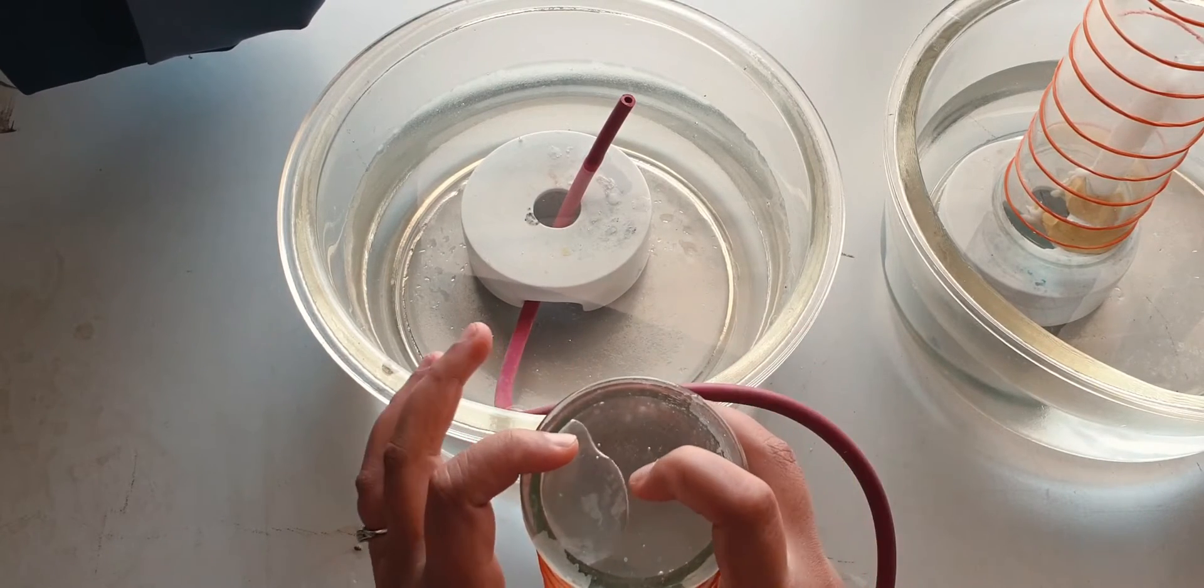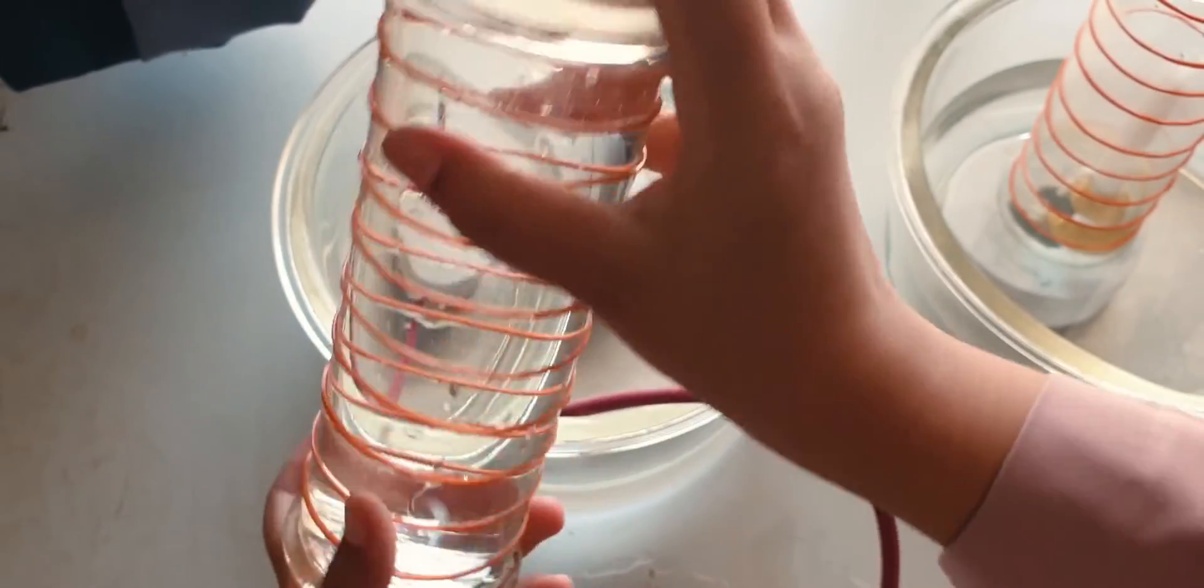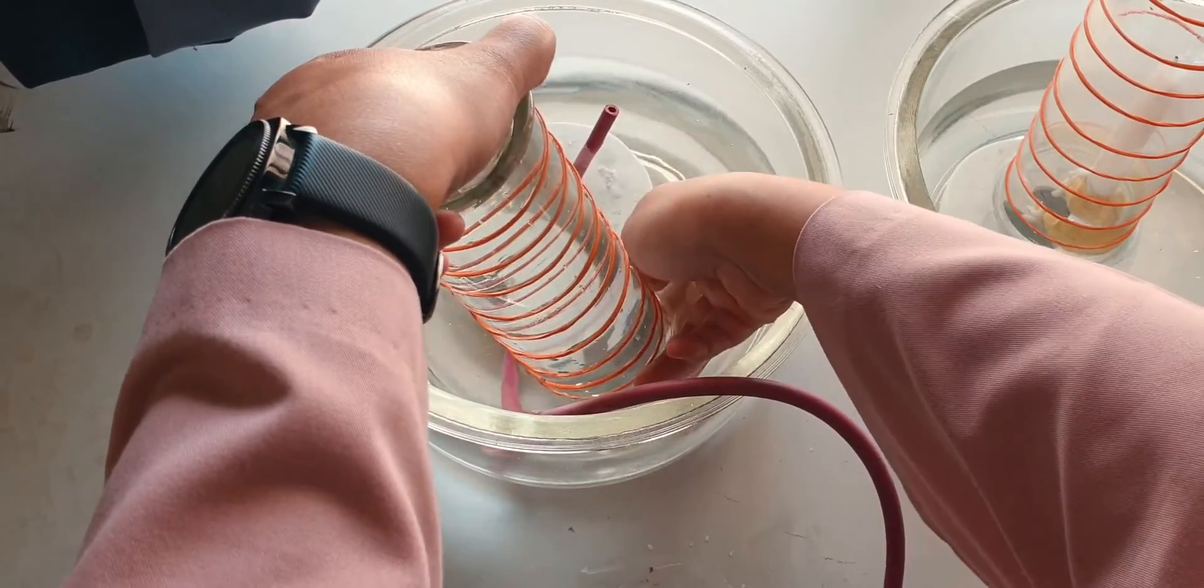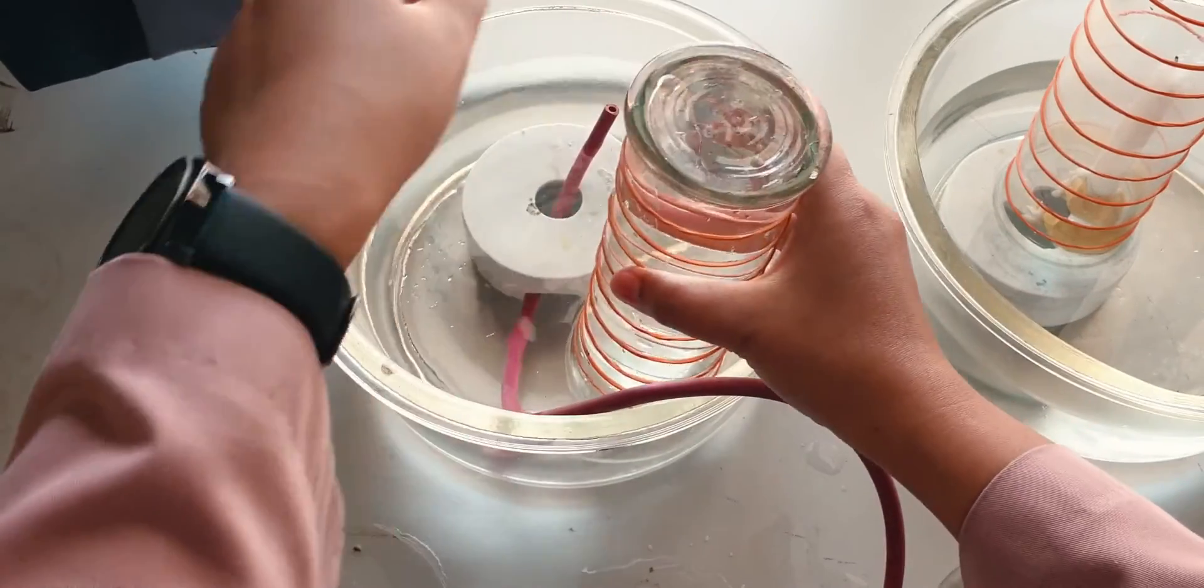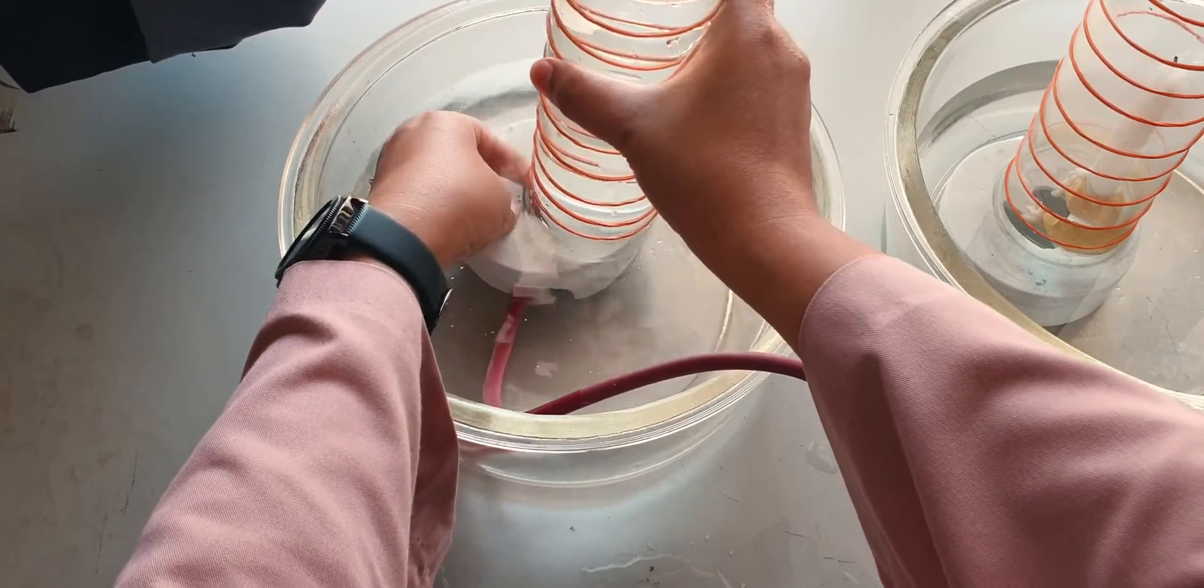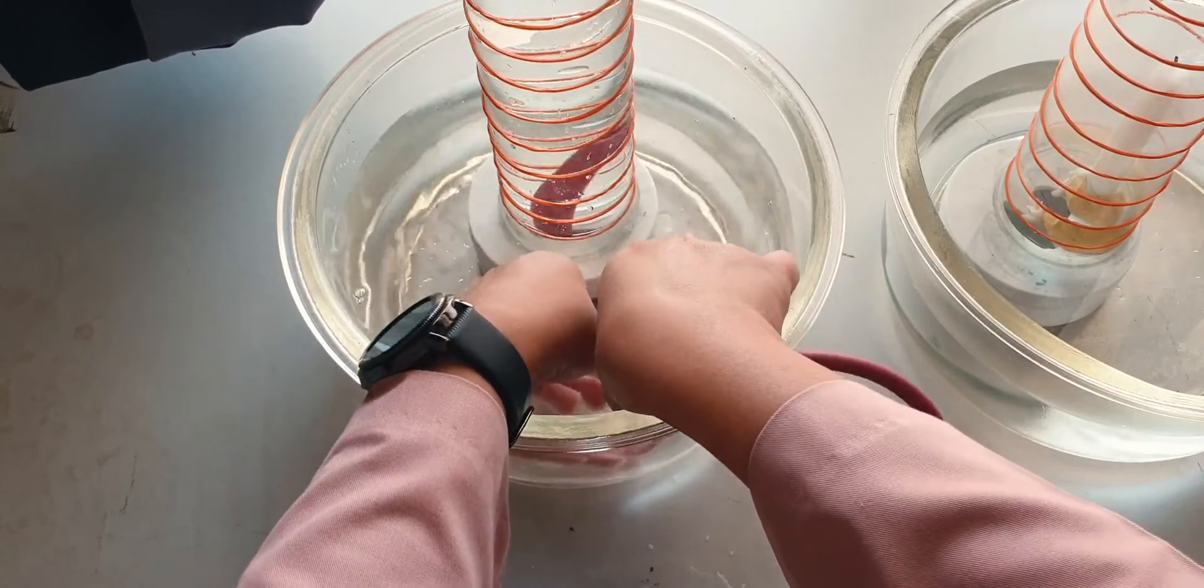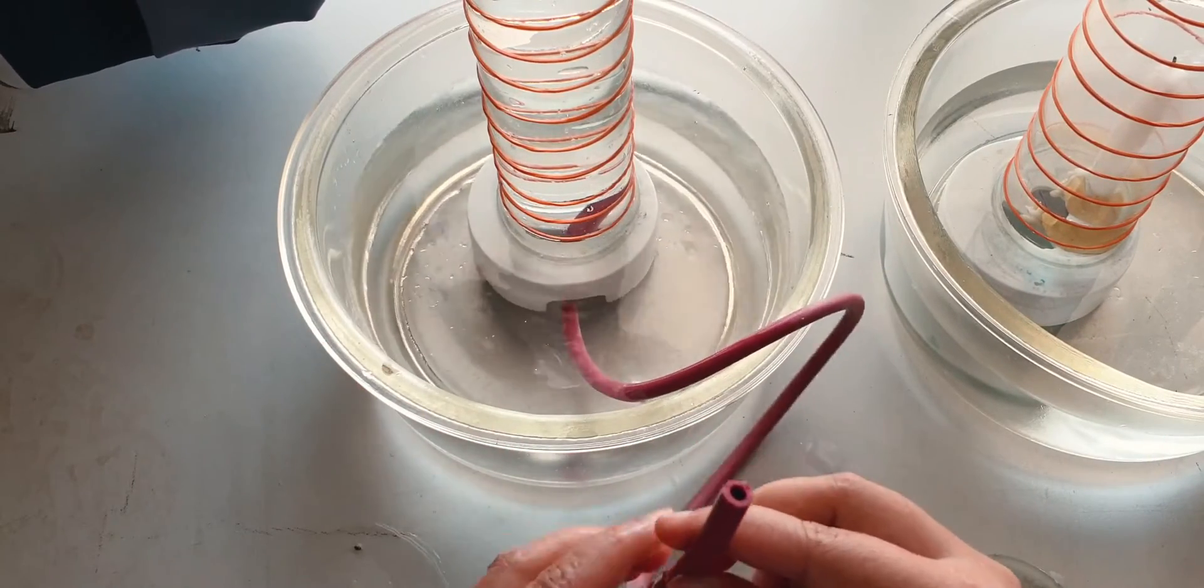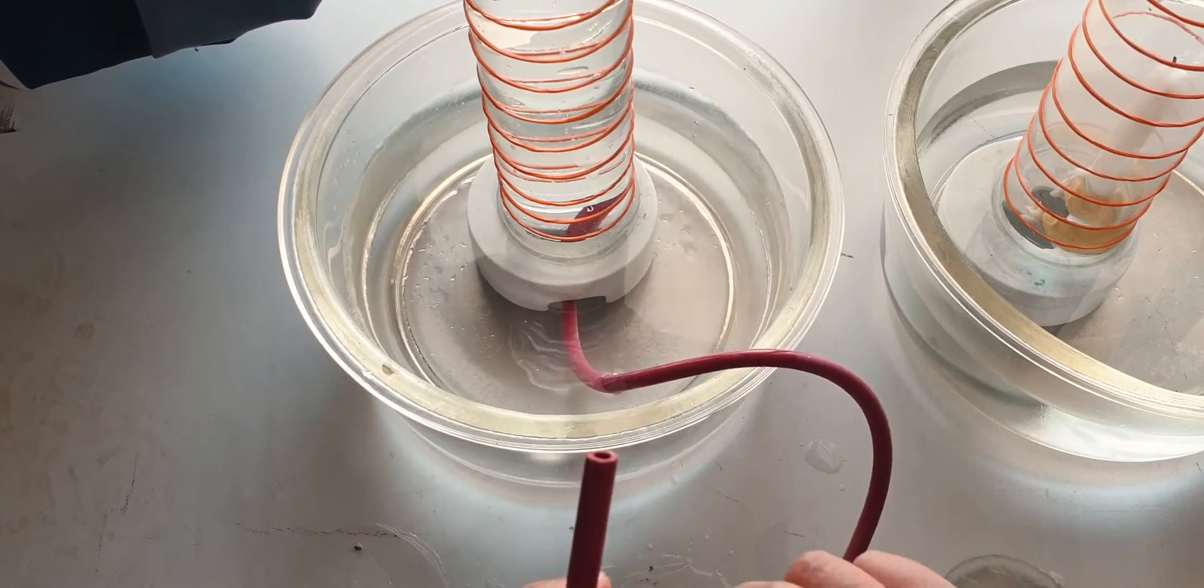Then I inverted it into the water immediately, like that. I took out the glass cover and I will put it on top of the tube.